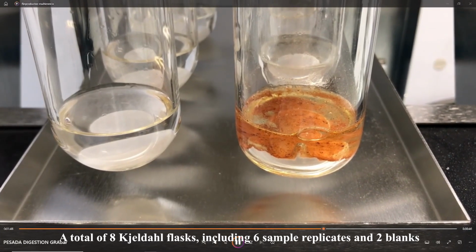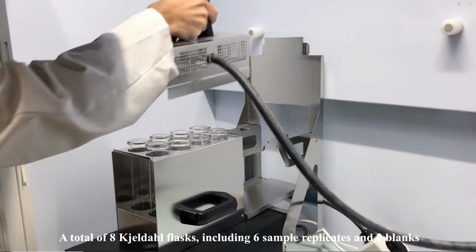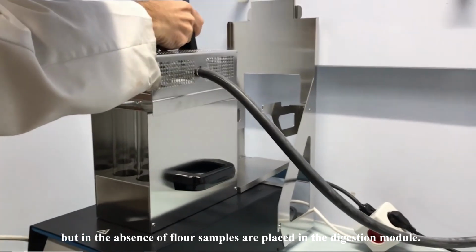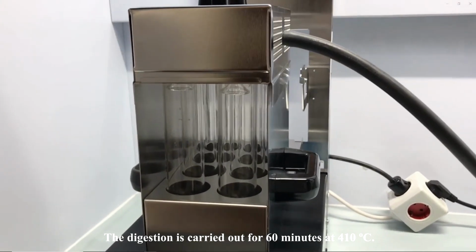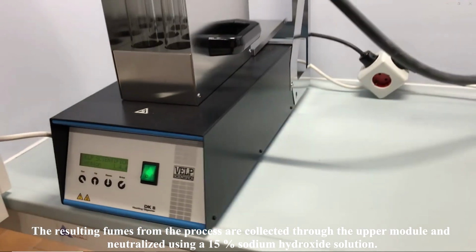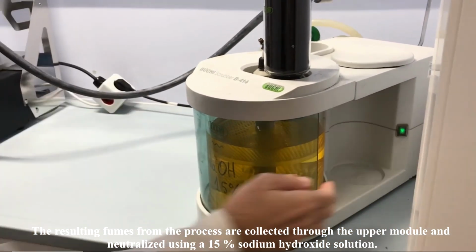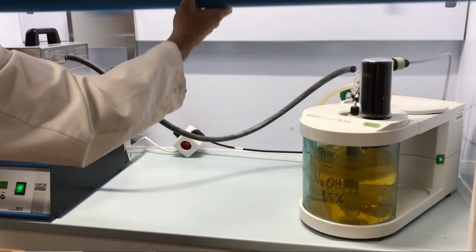A total of 8 Kjeldahl flasks, including 6 sample replicates and 2 blanks, but in the absence of flour sample, are placed in the digestion module. The digestion is carried out for 60 minutes at 410 degrees Celsius. The resulting fumes from the process are collected through the upper module and neutralized using a 15% sodium hydroxide solution.